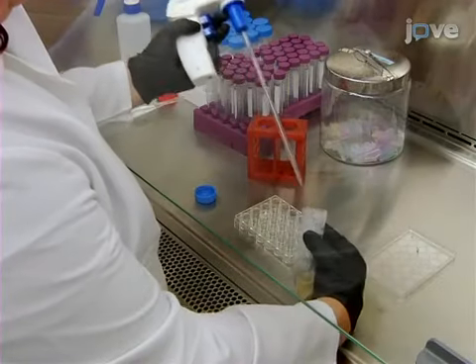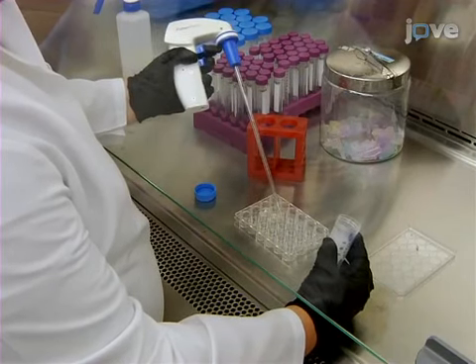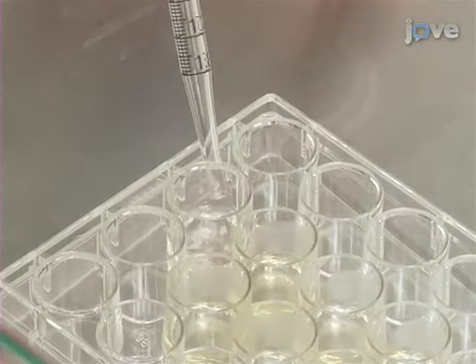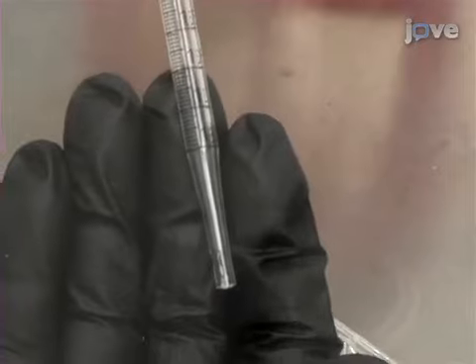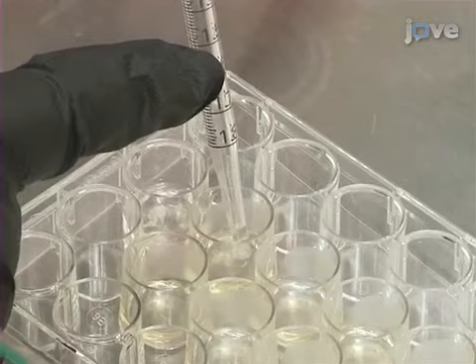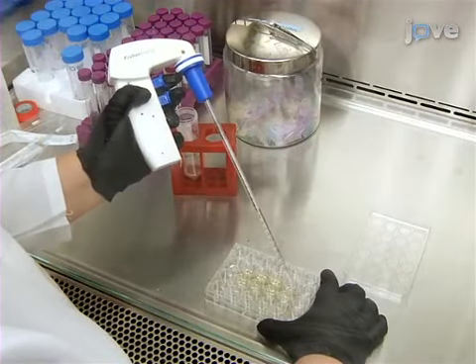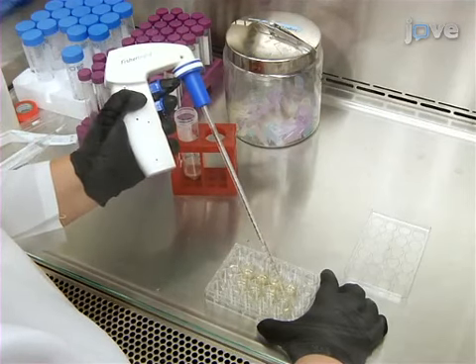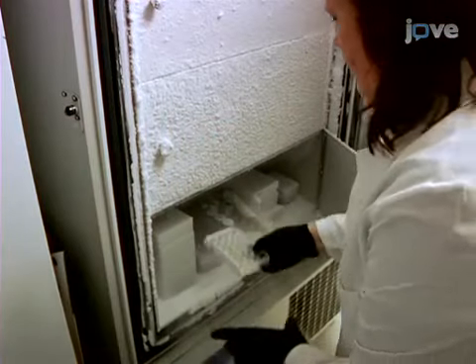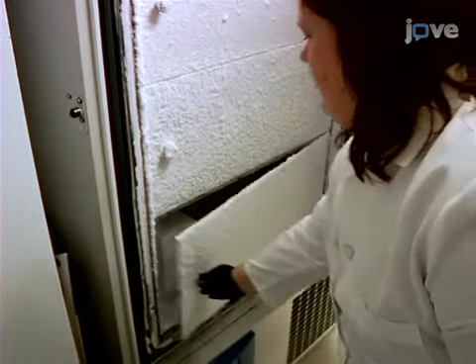Using a 2 milliliter serological pipette, deposit 0.6 milliliters of the warm gelatin solution into the wells of a 24-well flat-bottomed plate. Deposit the washed three-dimensional cell cultures immediately on top of the gelatin layer, using a different 2 milliliter pipette to avoid rupturing the three-dimensional structure. After the cell cultures are placed on the surface of the gelatin layer, carefully pipette another 0.6 milliliters of the warm gelatin mixture over them so as to not disturb their position. Following this, freeze the gelatin-embedded three-dimensional cell cultures at -80 degrees Celsius.